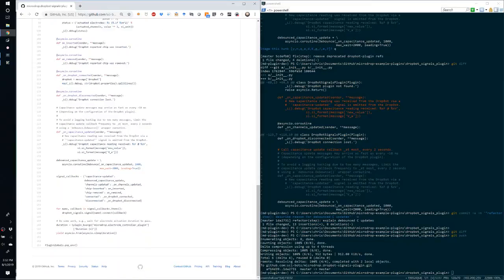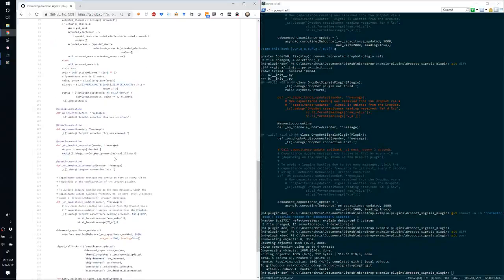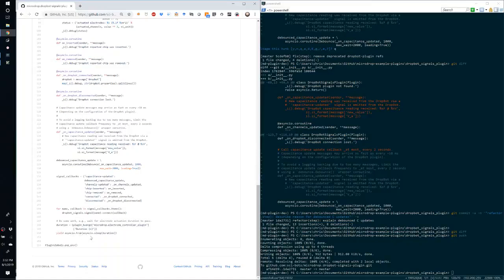So we can look up values from other plugins if we need to in the plugin keyword arguments. And then in this case, we're just looking at that duration. We're going to sleep for that duration, which means that these callbacks will continue logging until this sleep duration is complete.